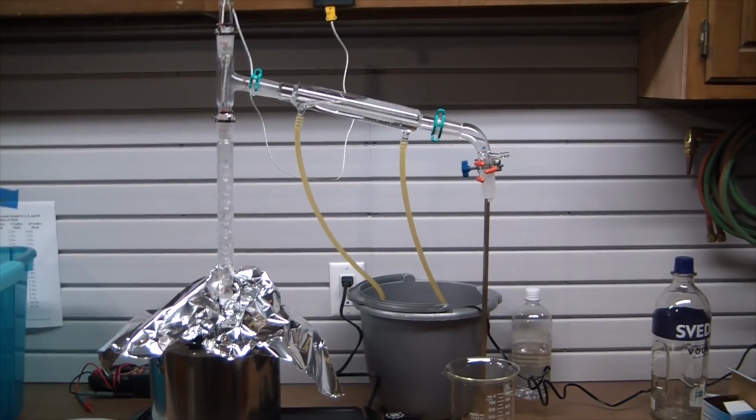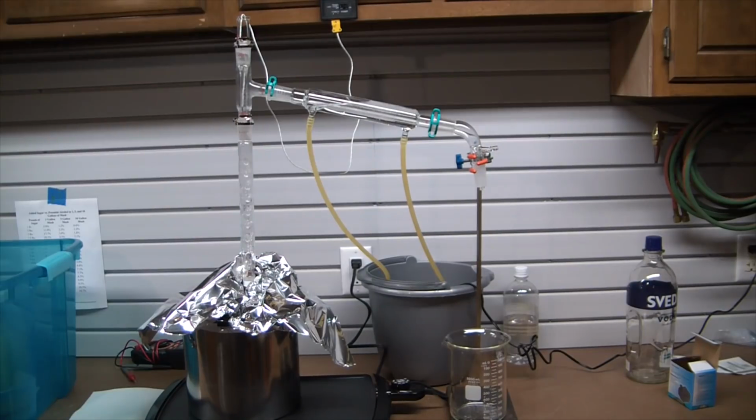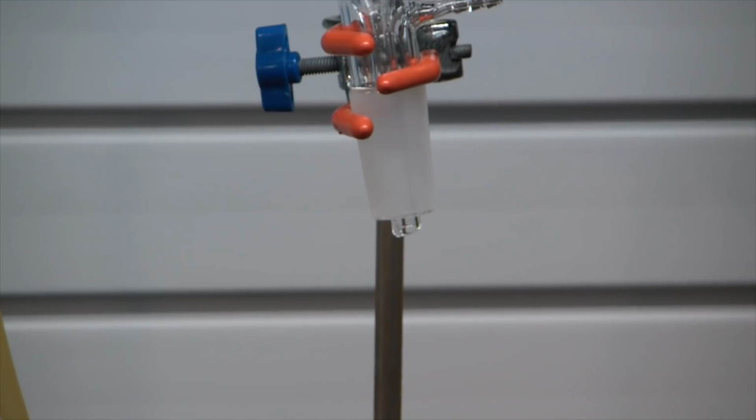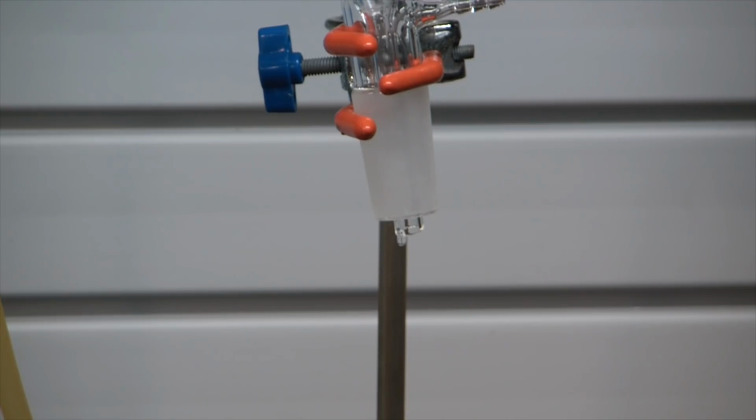All right, she's up to temperature. You can see we're reading exactly 100. As you can see, I had to insulate the pot there. The griddle wasn't putting out quite enough heat for it, but once I put that aluminum foil on top, no problem. Vapor front went right up the Vigreux column nicely over to the condenser, and we're getting drippage. Beautiful.